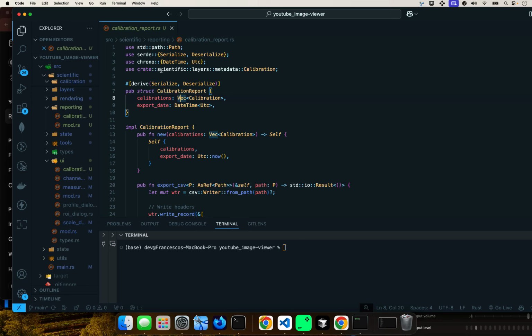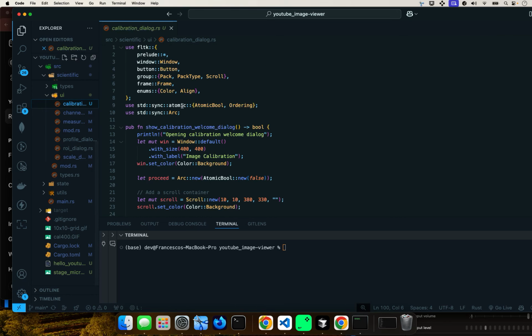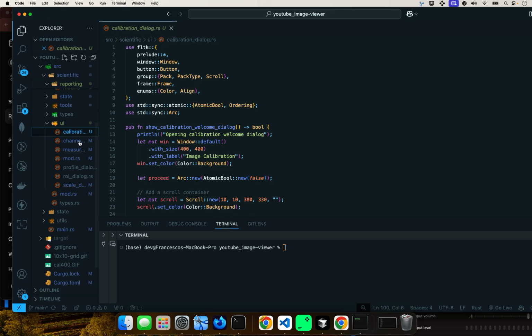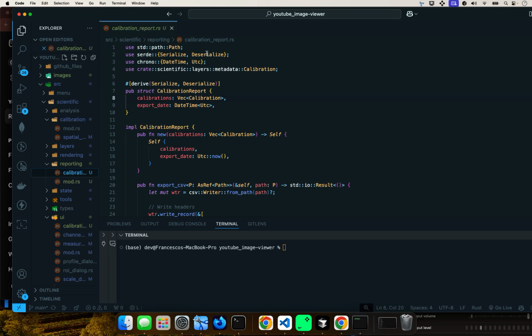Basically here we're bringing in the standard path, which provides a way to handle file paths in a platform independent way. We worked with Serde before. This works together with, if you remember from the Cargo.toml file, it's right there. It works with JSON, and you can also do it for YAML files. We did that a few tutorials ago. We're using it again to serialize and deserialize images. That's not the one. This is the one. So this is why I'm bringing it here.